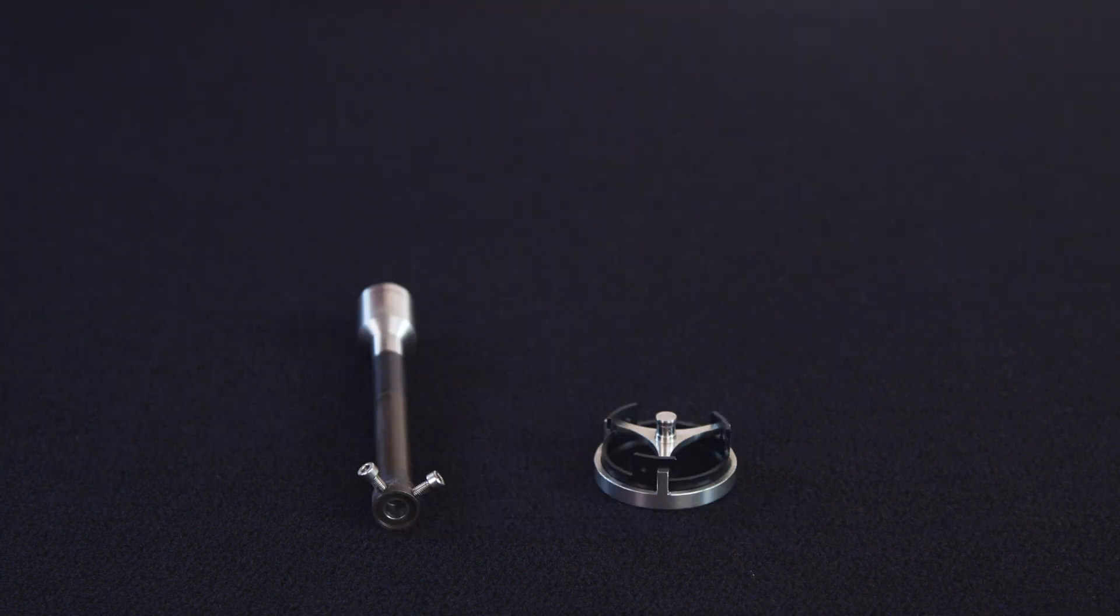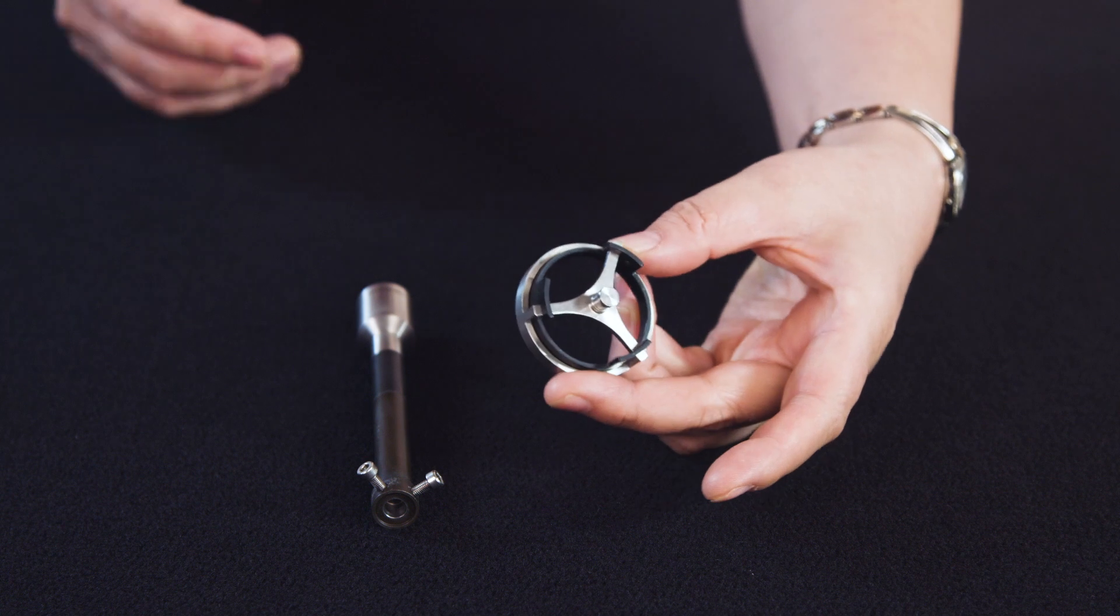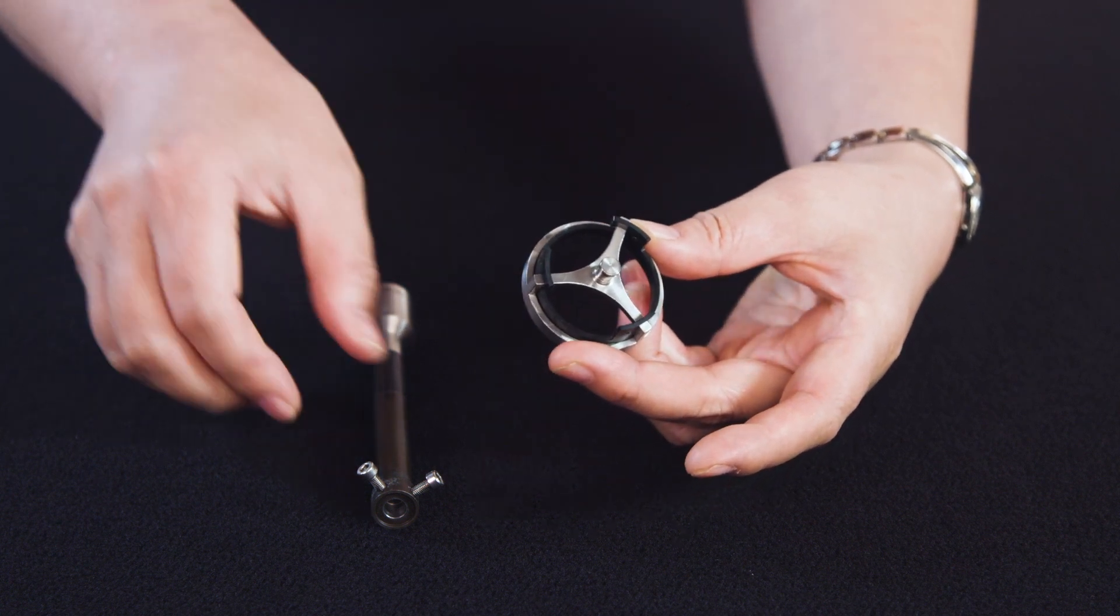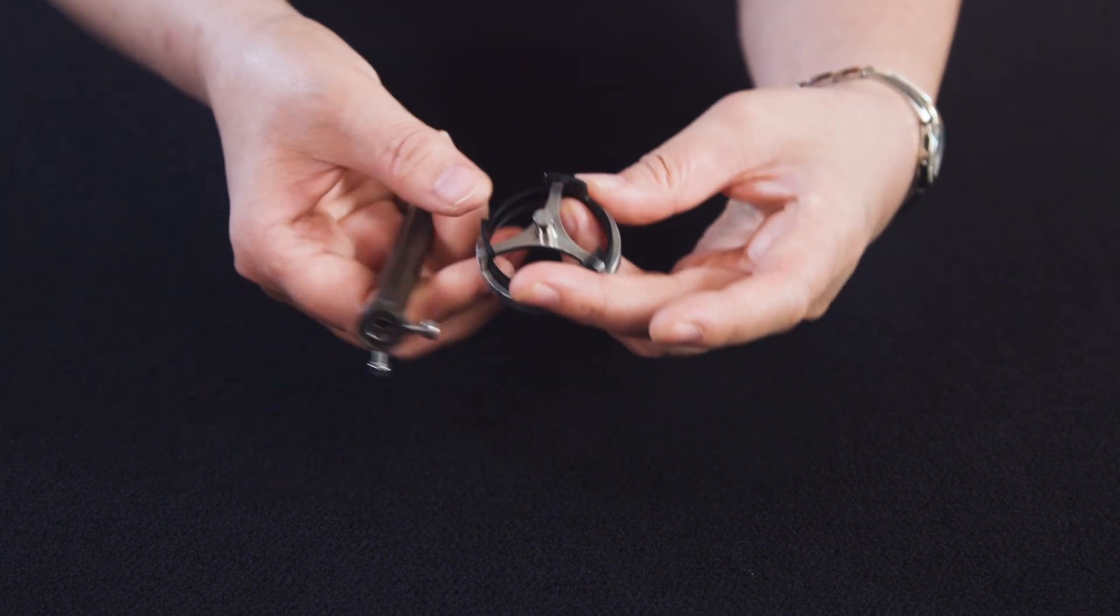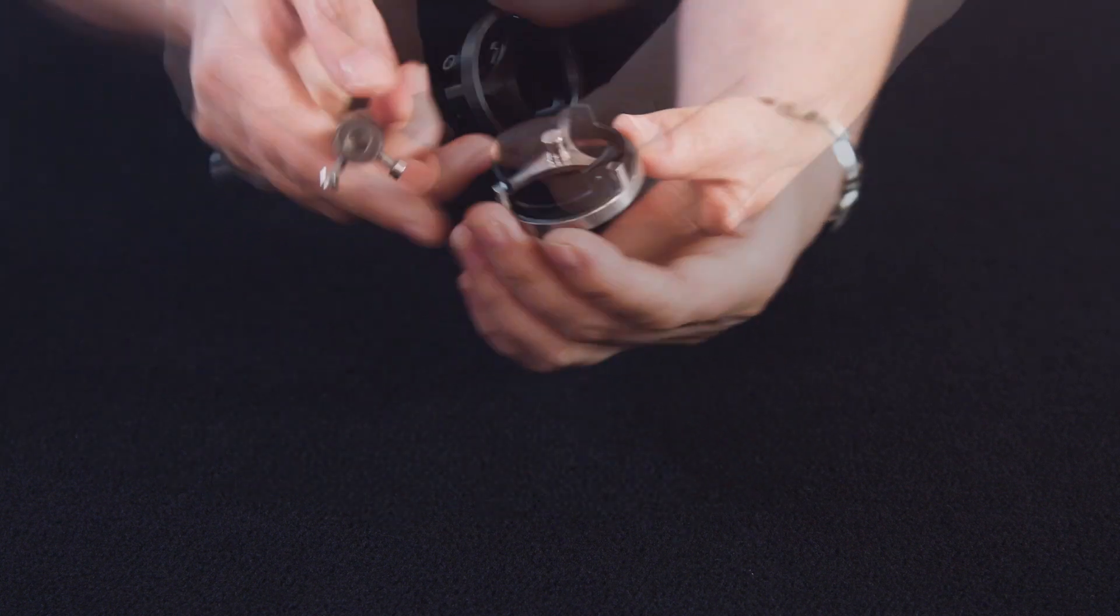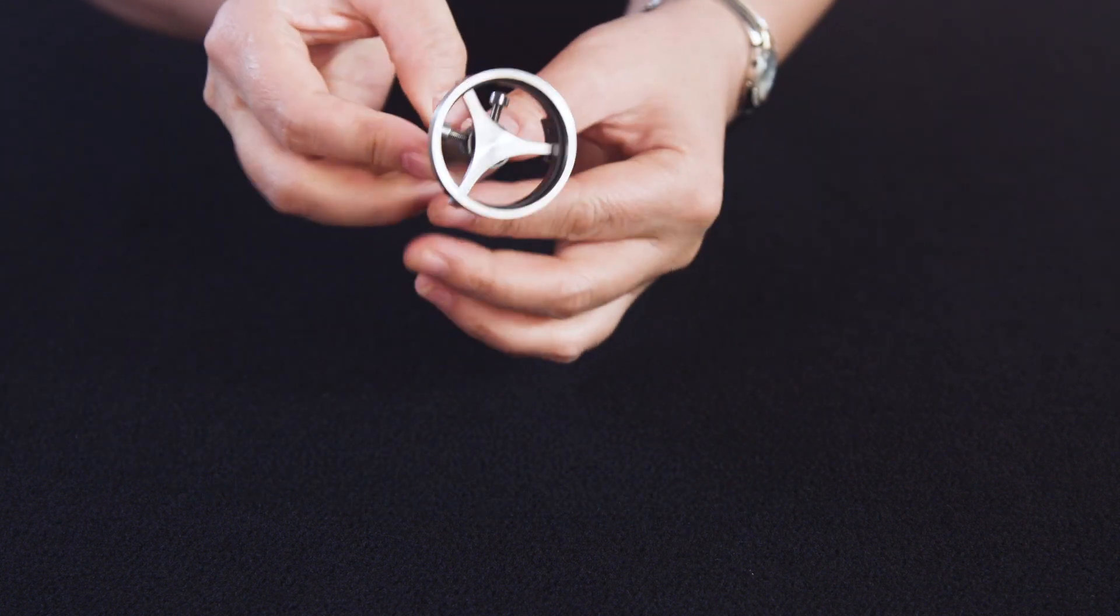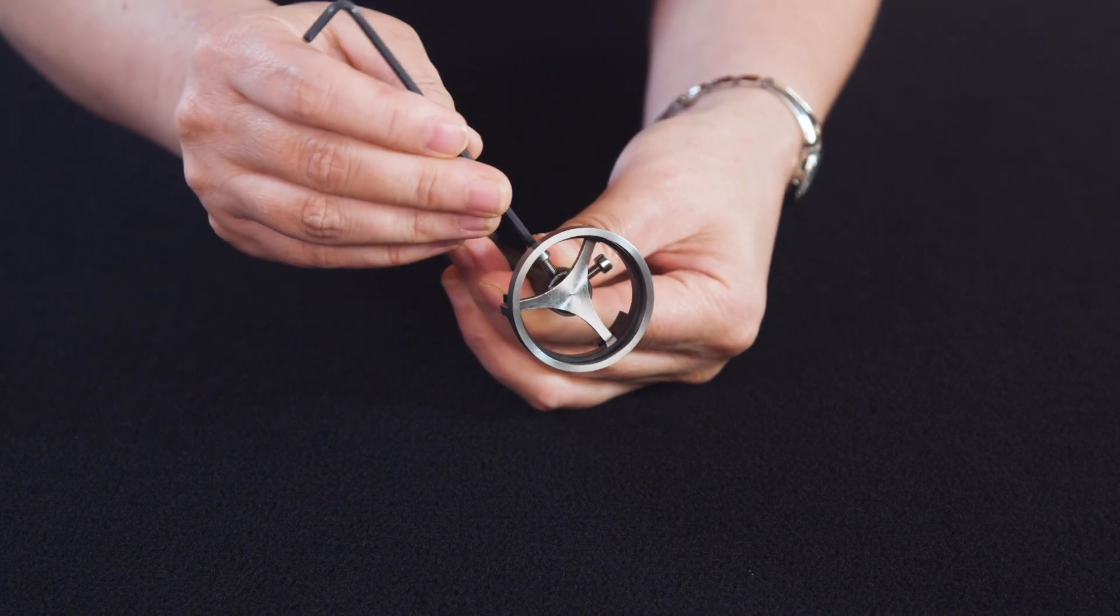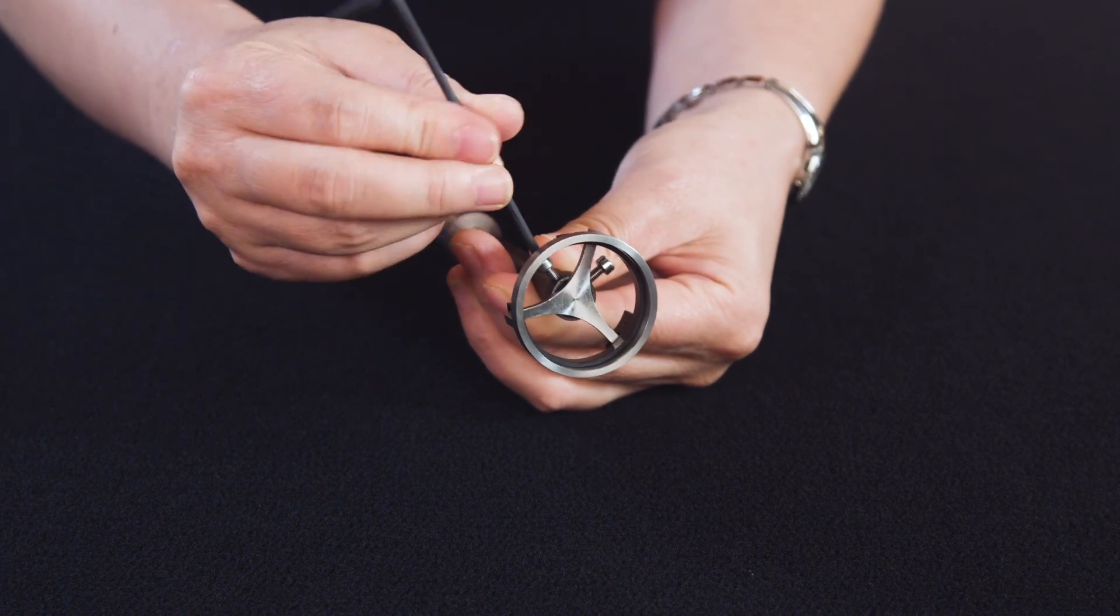Insert the inner trim ring and make sure it is raised up and sits on the rack of the annular ring. Then, load the annular ring to the upper shaft.